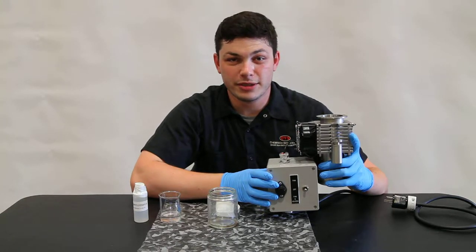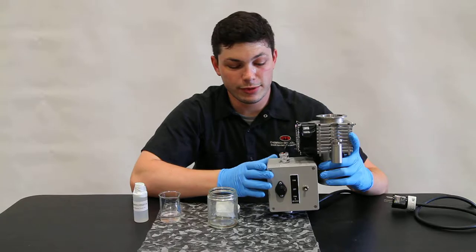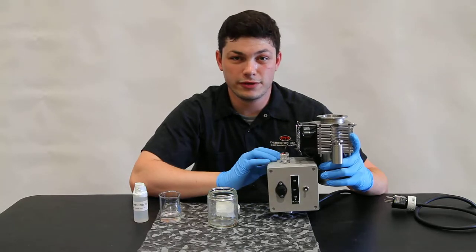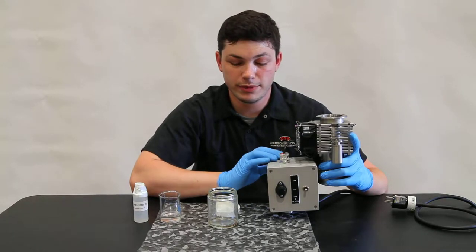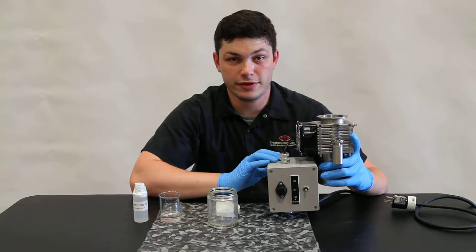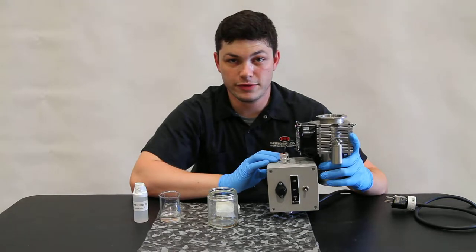Hello, this is Eric Rosner from Chemtech Services Incorporated. I'm going to show you how to remove your diffusion pump oil from your diffusion pump and how to add the diffusion pump oil back into your diffusion pump.